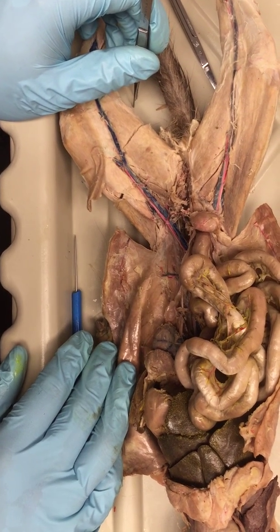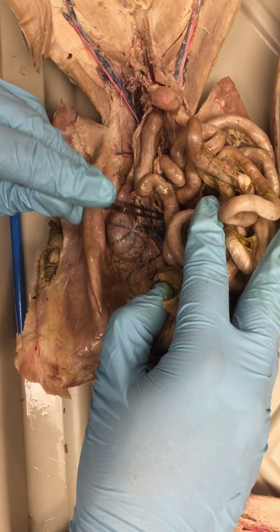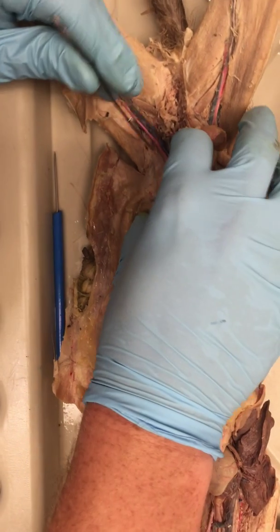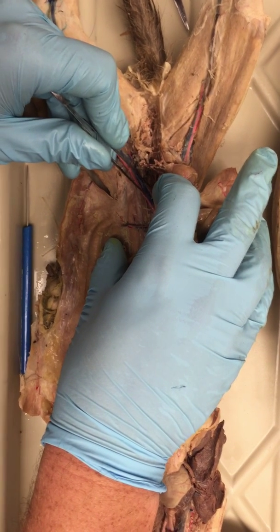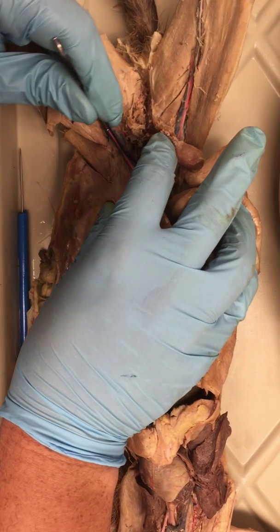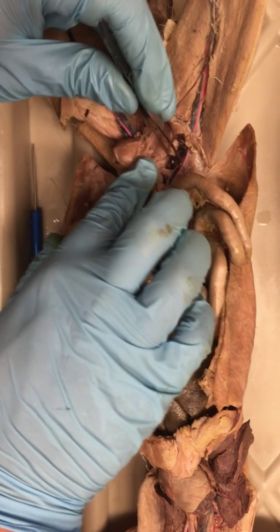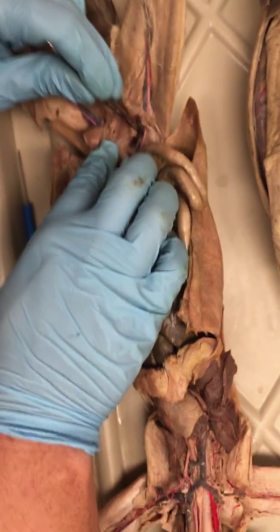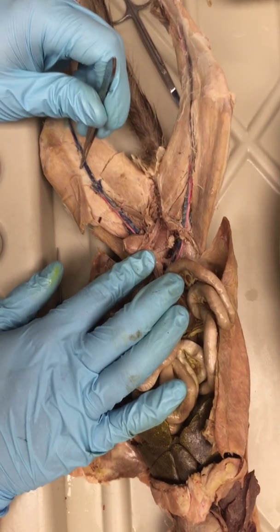Okay, let's do the veins in this area real quick. So we already know, here's the adrenal lumbar vein, this is the posterior vena cava, this is the renal vein, this is the iliolumbar vein, and down here, where all of the iliacs are, that's where things get a little more complicated. This is a common iliac, and then it branches into the internal iliac. Let's look at the other side. There it is. So it starts off as common iliac, branches into the internal iliac and the external iliac, which of course becomes the femoral out here, and of course the popliteal and the saphenous.